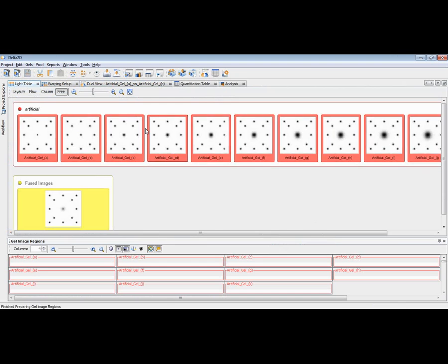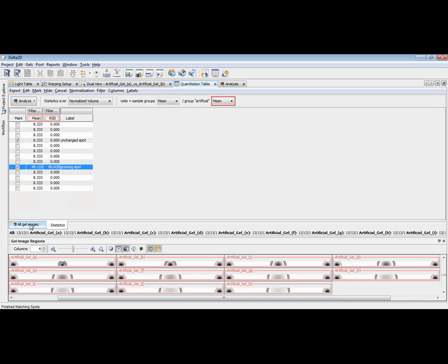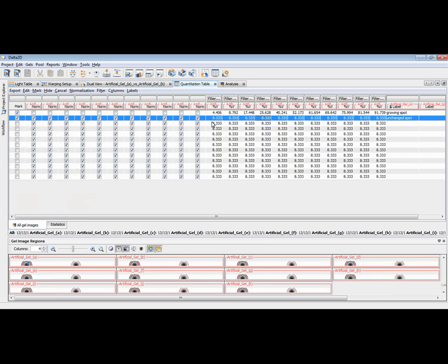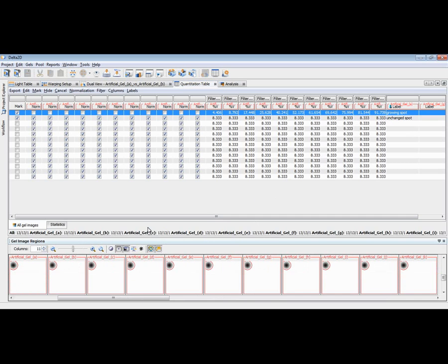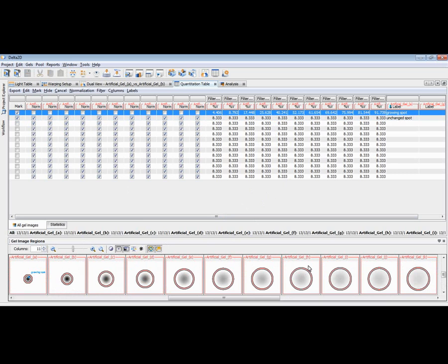Here we go. In the light table, we have all these different images, artificial images. And then let me show the quantitation table for it. We can now see, if we sort them, there are the unchanged spots which have the same spot quantity across all the images, but one spot is a growing spot. It has a small and then an increasing amount of protein. And if we then have a look at this spot, we can of course also review it here. This is an example of the spots that do not change, and this is the spot that is increasing its volume.